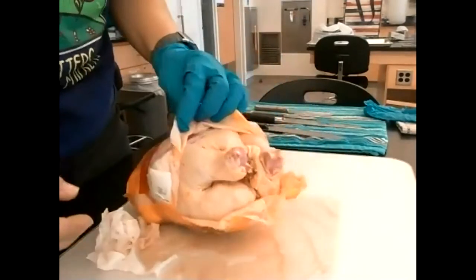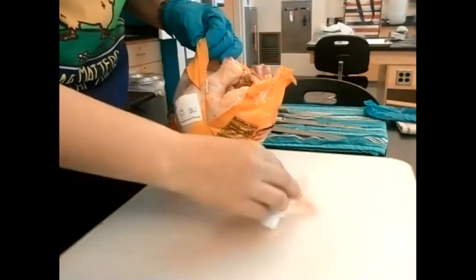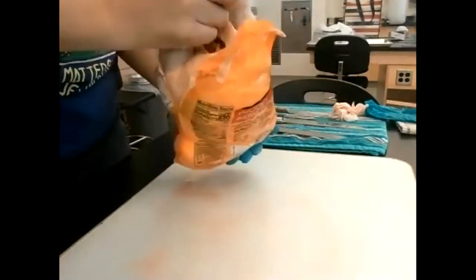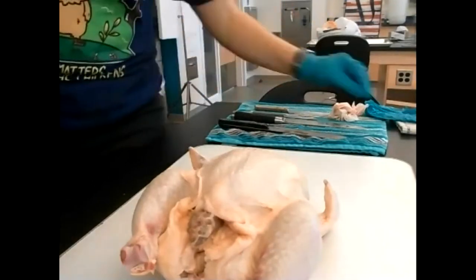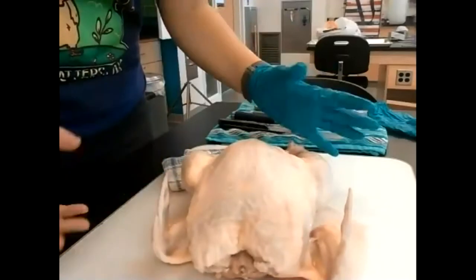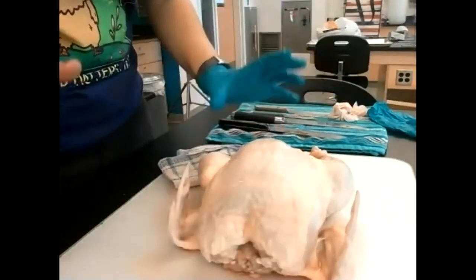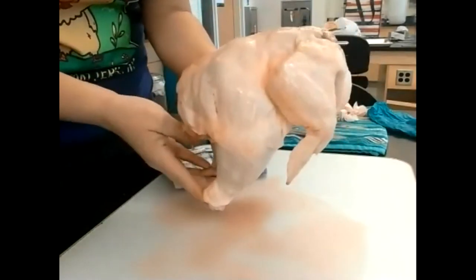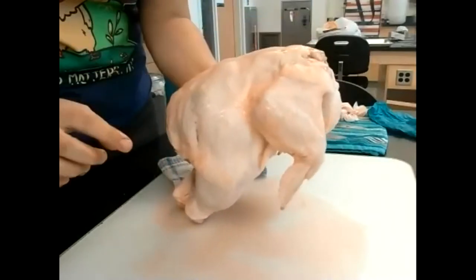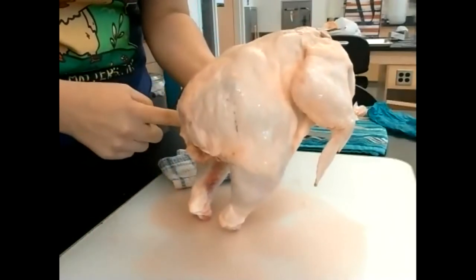So the chicken — I haven't even taken it out of the bag yet, so this is exactly what you're going to see. If the chicken was standing, here are the legs, here are the wings, and the head would be up in this direction. This is the chicken's right, and this over here is the chicken's left. Note that the skin is on the lateral side of the chicken leg.